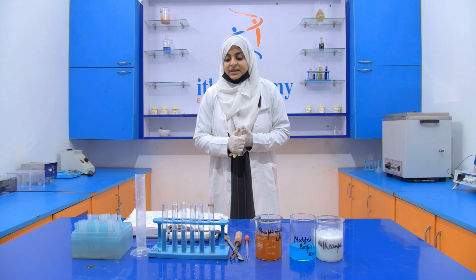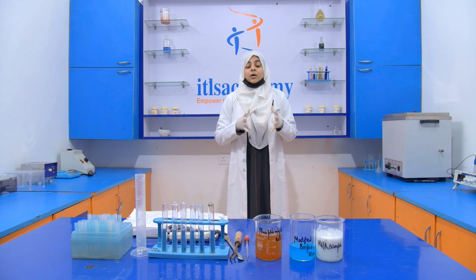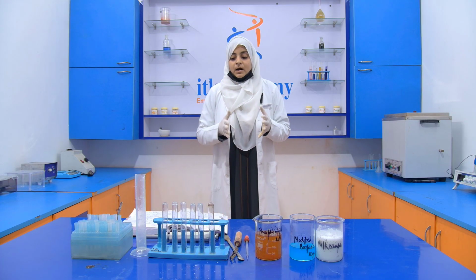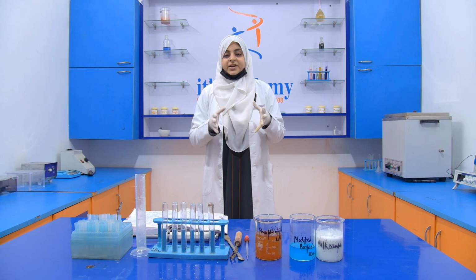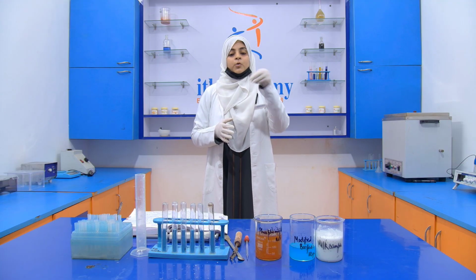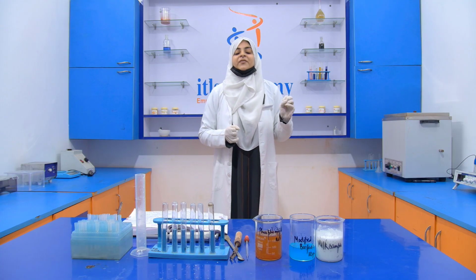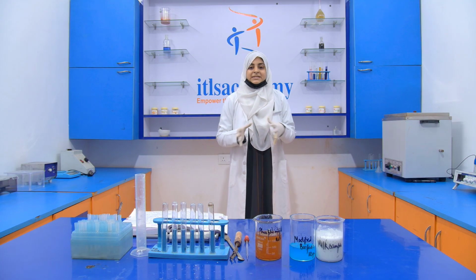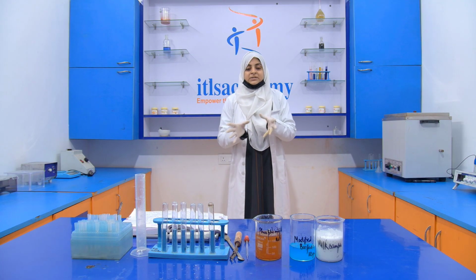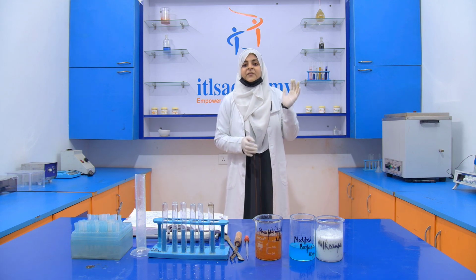Okay. Then after that, we add 125 ml of the not diluted solution, after checking that the ammonia is gone. We cool it down to 25 degrees Celsius. Then we make up the volume to 350 ml. We see what the volume of that solution is, and we make up the volume to 350 ml.